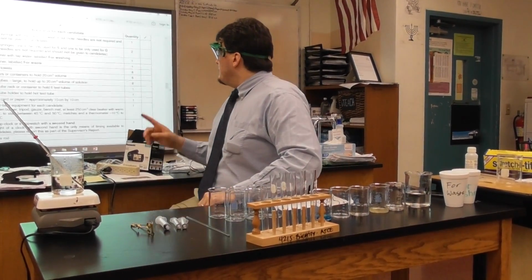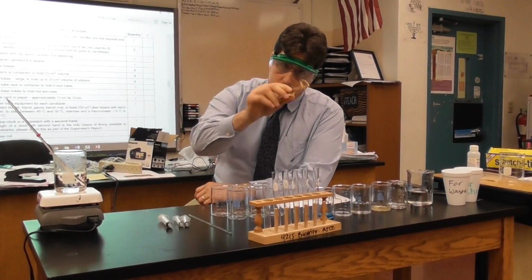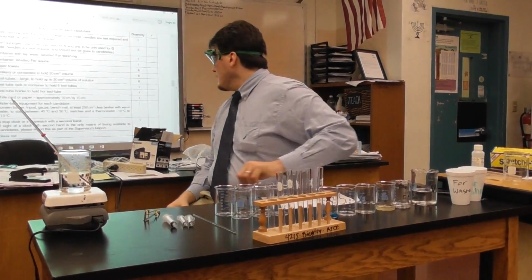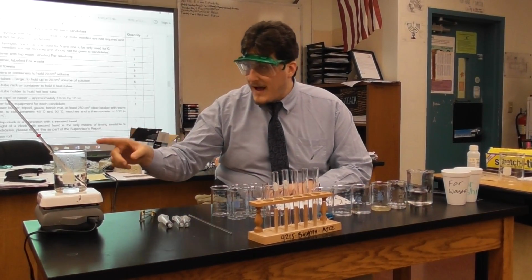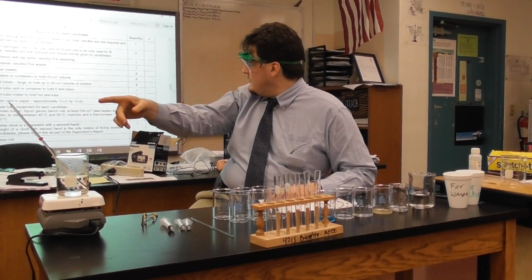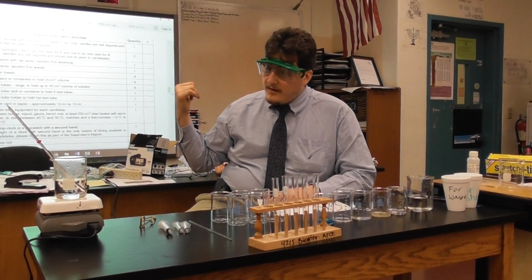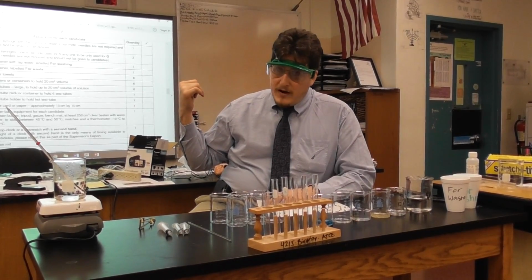So we have a white card, or white paper anyway, and we're also going to have a test tube holder. We're going to have a water bath, which is a hot plate, not the Bunsen burner setup that Cambridge requests, because I don't like fire. Bad.